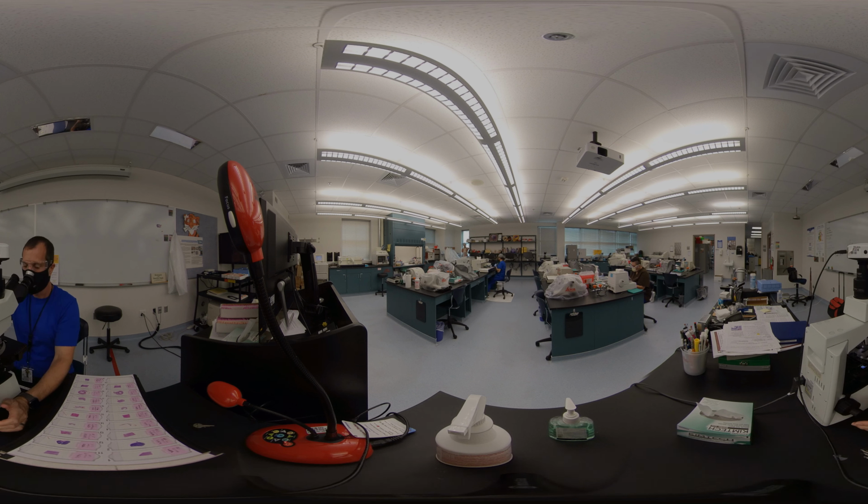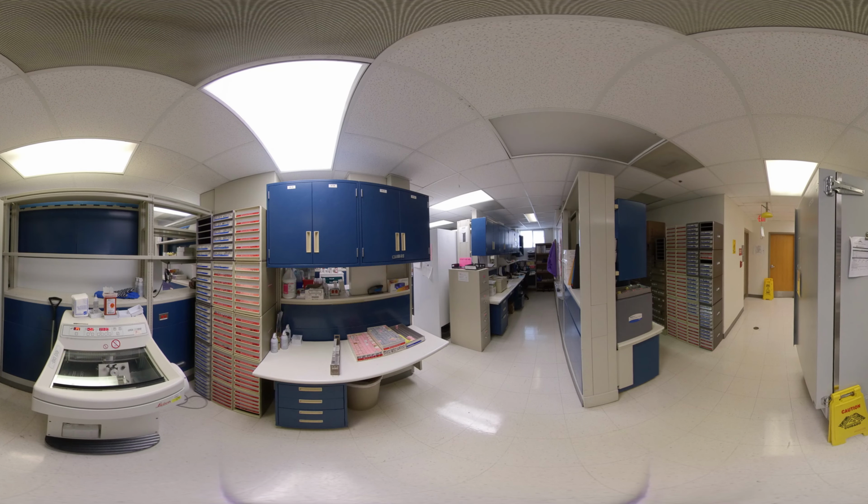As stated in our previous lesson, once the pathologist is done with the slides, the blocks and slides will be stored in an archive for at least 10 years. This ends another lesson for the introduction of clinical histology.